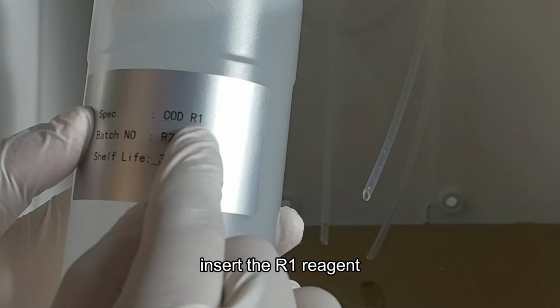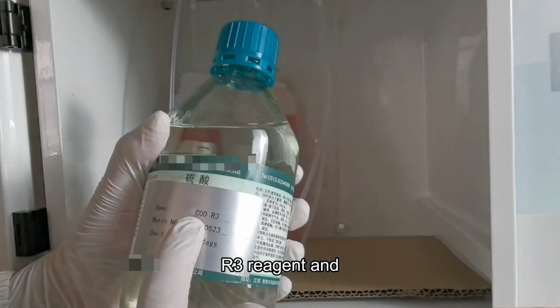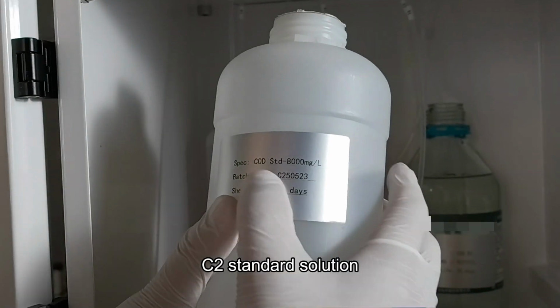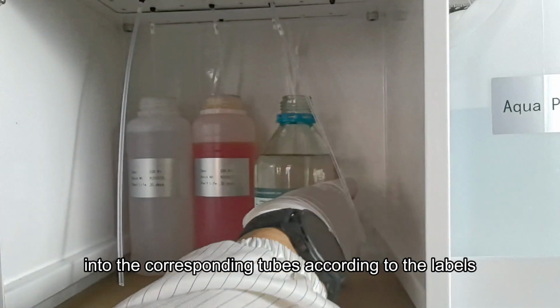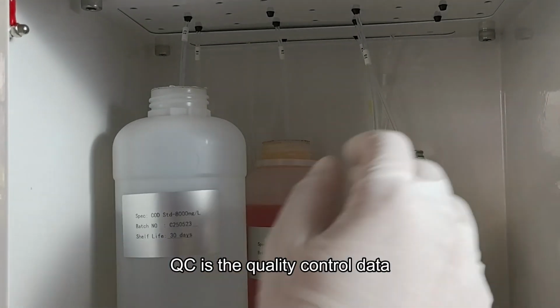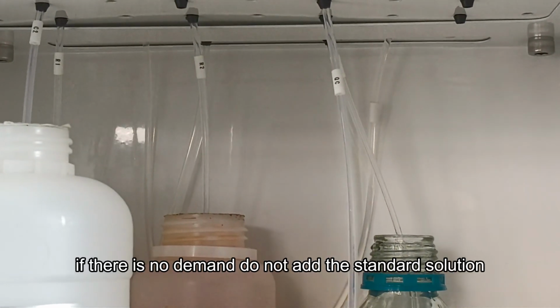Insert the R1 reagent, R2 reagent, R3 reagent and C2 standard solution into the corresponding tubes according to the labels. QC is the quality control data. If there is no demand, do not add the standard solution.